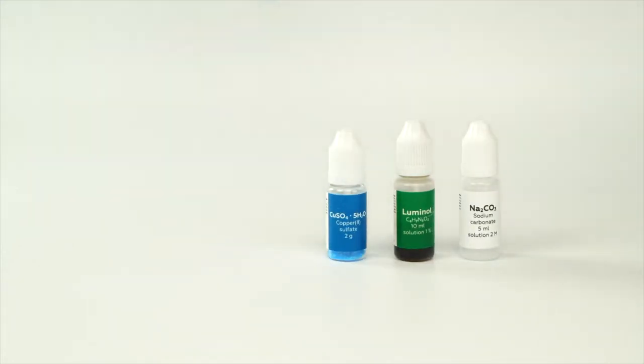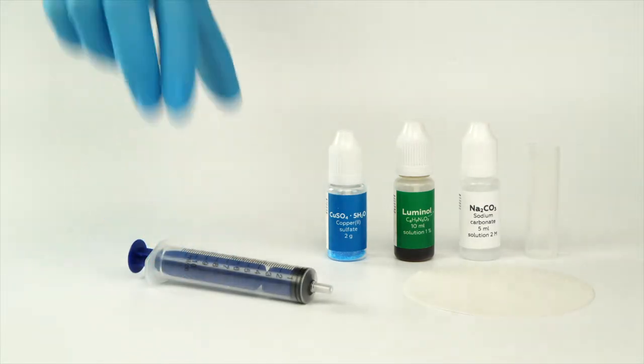For the luminol volcano experiment, you will need solutions of sodium carbonate, luminol, and copper sulfate. You'll also need a vial, a piece of filter paper, a syringe, and a measuring spoon.